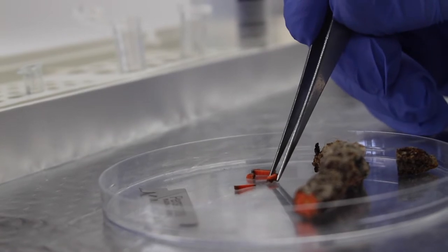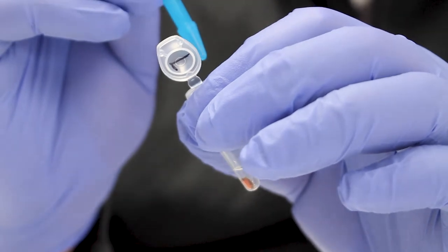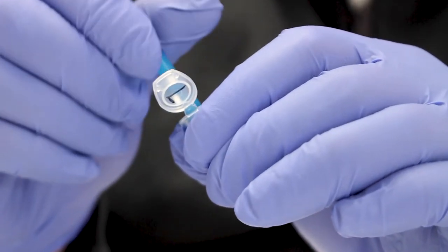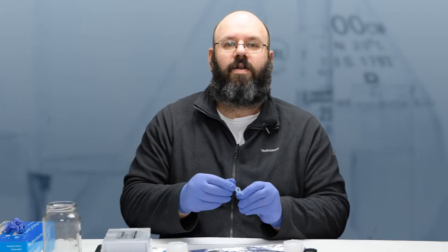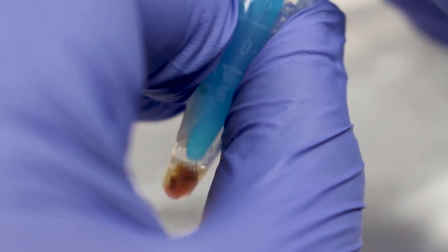Now, insert the sub-sample into the extraction buffer tube. Using a pestle, grind it for 10 seconds or until it's mostly pulverized. In combination with the grinding of the sample, the buffer will rupture the cell membranes and release the DNA.